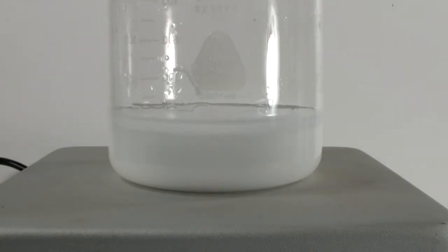When I turn off the stirring, you can see how heavy this stuff is. I was impressed with how quickly it settled out. That's heavy. I'm really impressed.